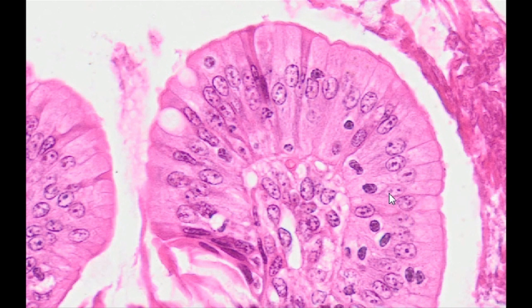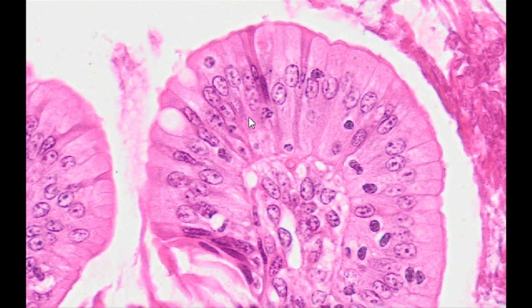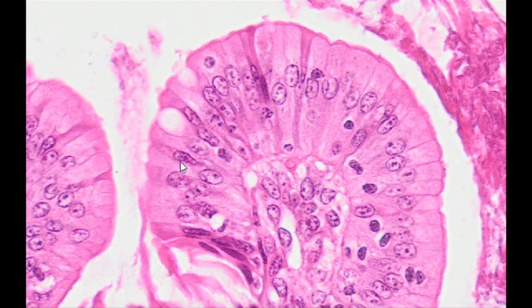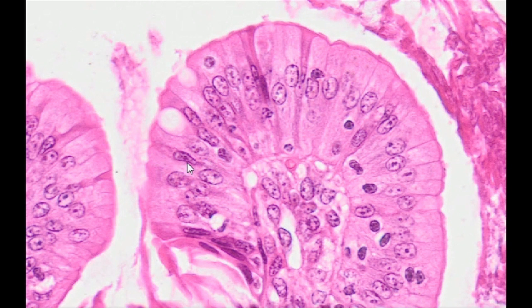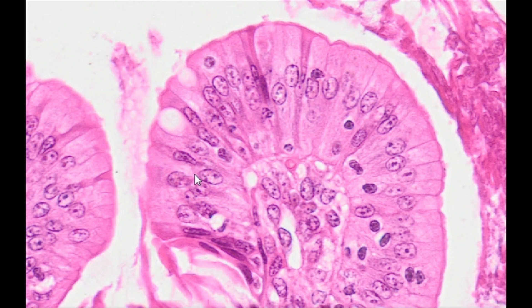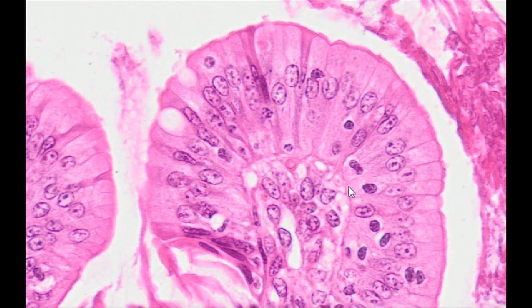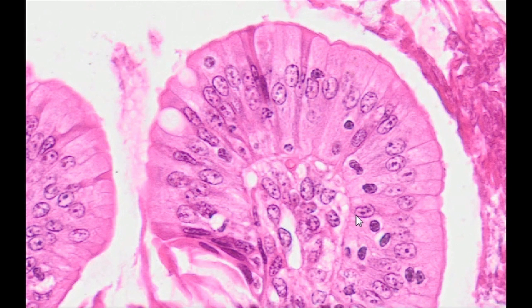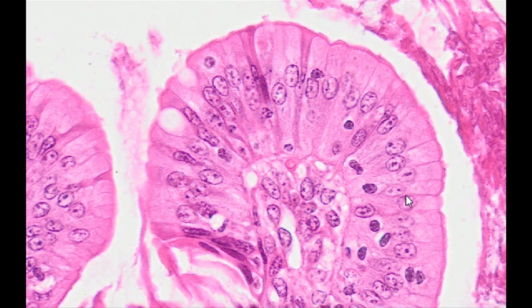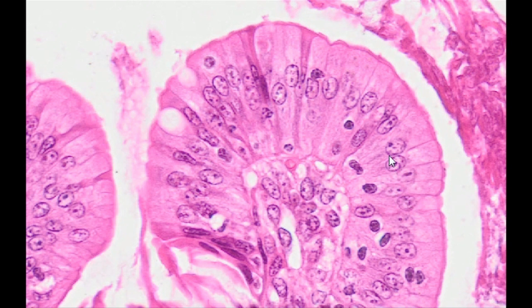Simple columnar epithelium is composed of a single layer of tall cells, the height of which is several times greater than their width. Each cell rests on the basement membrane. Cell nuclei are oval in shape and arranged in a single row, located in close proximity to the basal part of the cell.